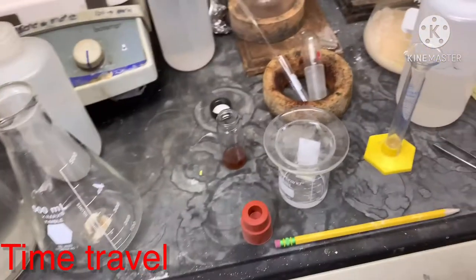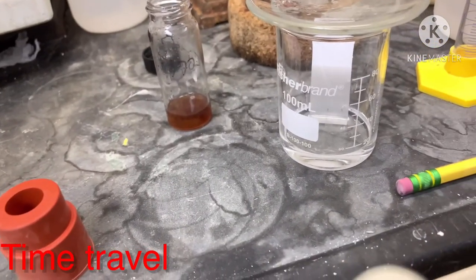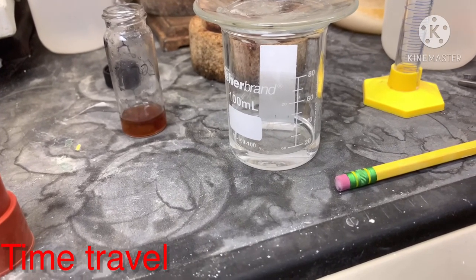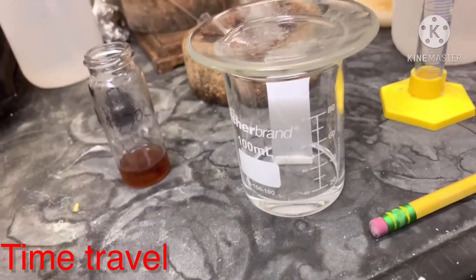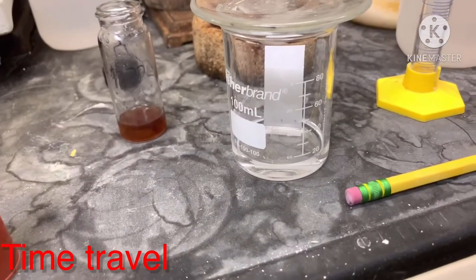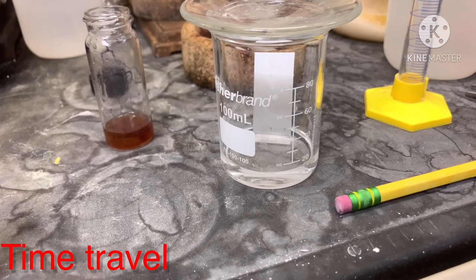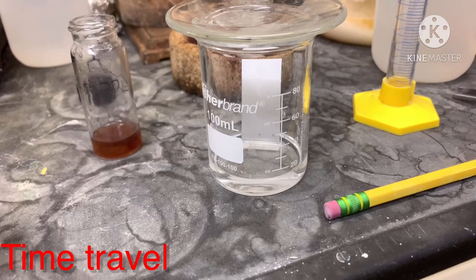Wait until the solvent almost reaches the top of the TLC plate — not completely to the top. When about half a centimeter of plate remains un-soaked, you can take out the plate. The solvent is called the mobile phase, and the silica layer on the TLC plate is called the stationary phase. The compound was spotted on the stationary phase and the mobile phase carries it upward as it runs.